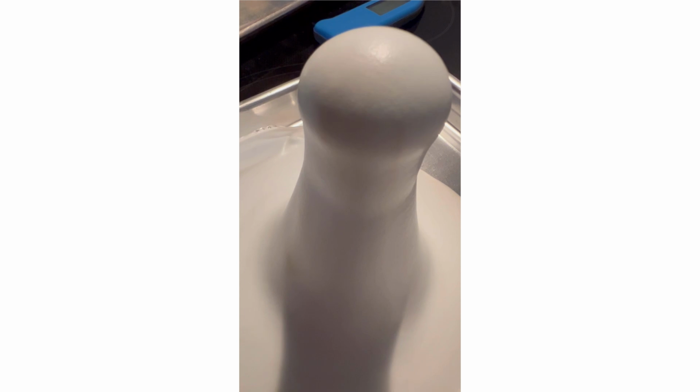So I think from the higher temperature, it's reacting quite a bit faster than trial D. Still going strong.